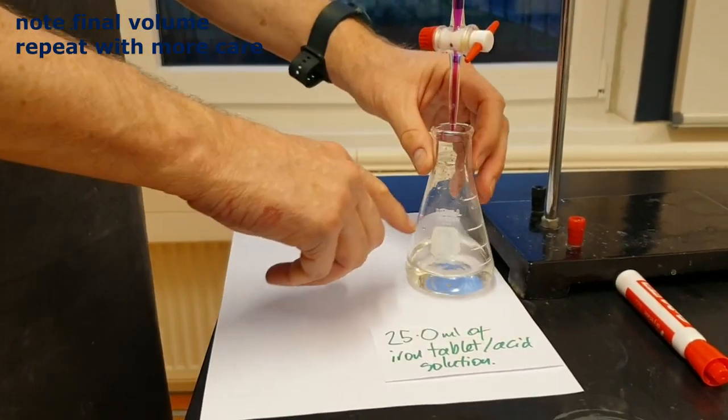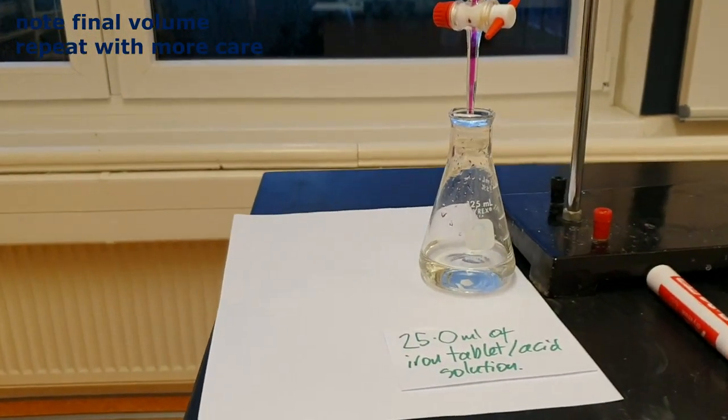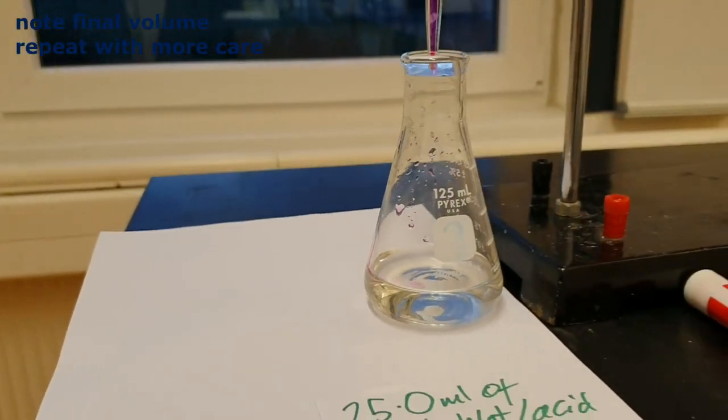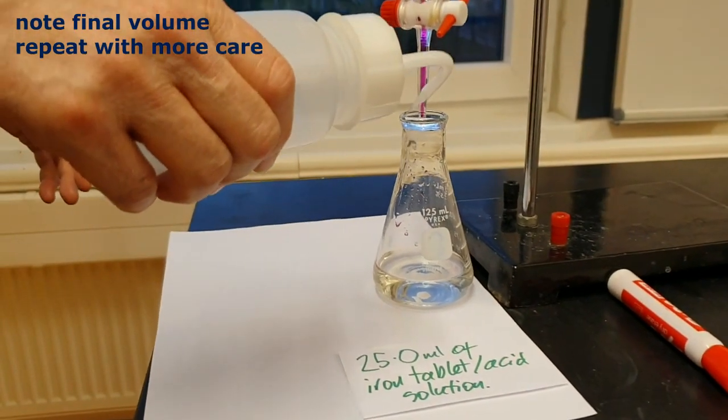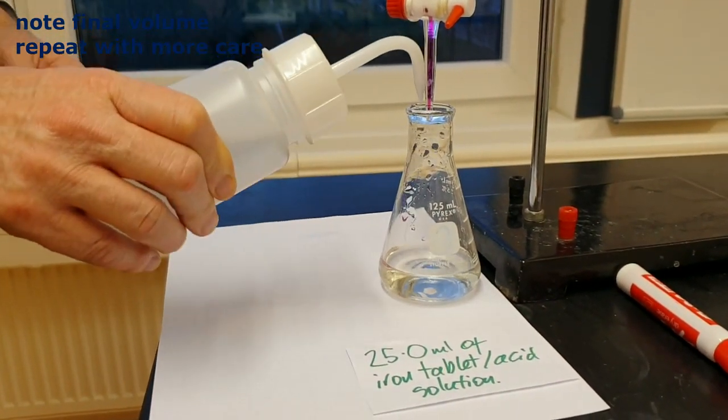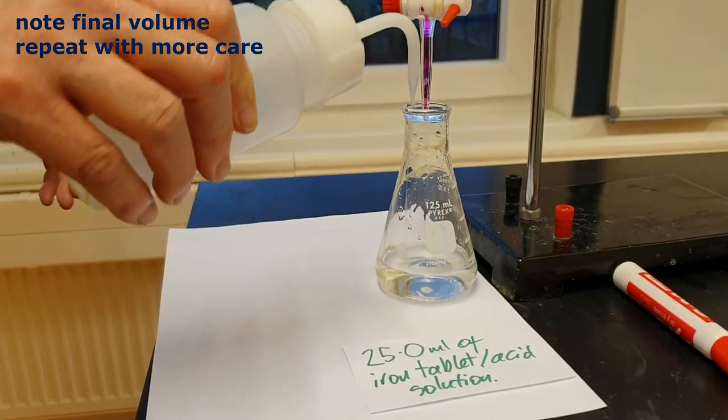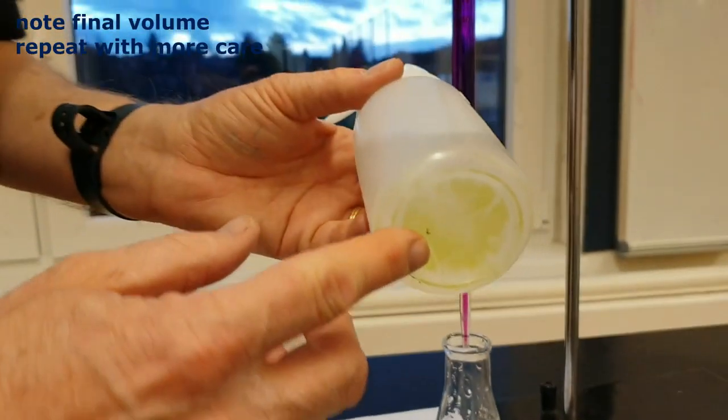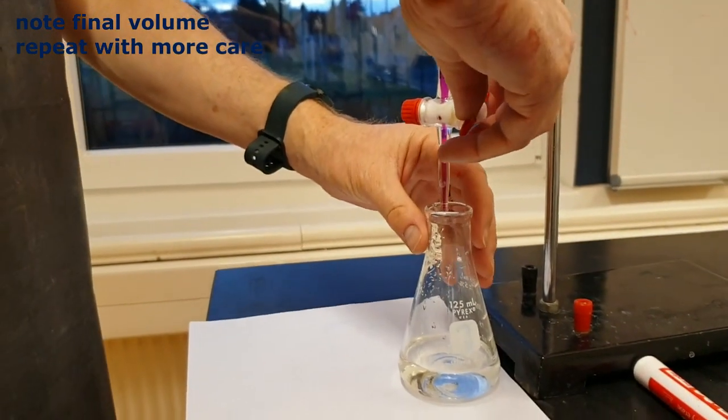Oh, now notice there's some side splash there. But that's okay. We can just wash that in with a bit of water. That doesn't affect the experiment. Just wash that in there. Oh, I've noticed that there's a photosynthetic life at the bottom there. Okay. Let's keep going.